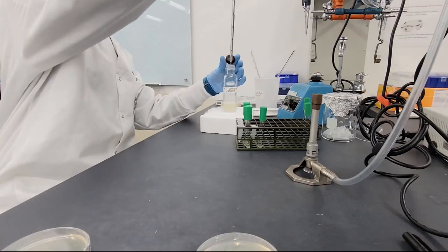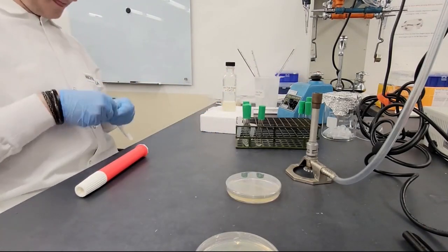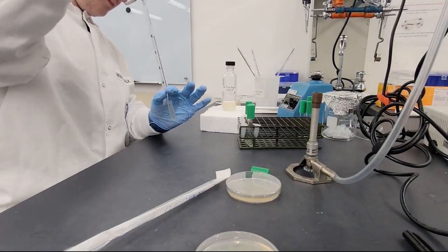We're not done, because now we have to calculate the concentration of our lysate and figure out exactly how much phage per microliter we have in here. And how do we do that? You're right. Serial dilution. We have to do another serial dilution, but we're going to do it to an extremely small amount because we don't know how concentrated it is. So all the way down to 10 to the negative 11. Then we're going to see the one that has between 20 and 200 spots. I was lucky enough to get one where I basically had to count 200 spots.